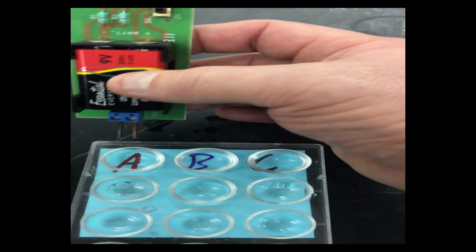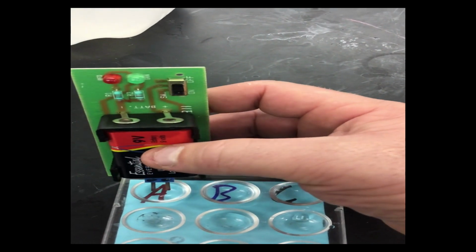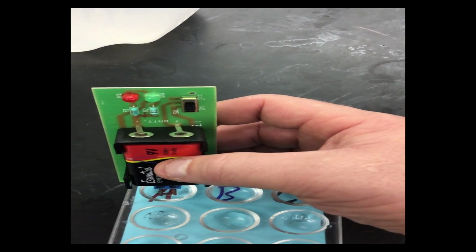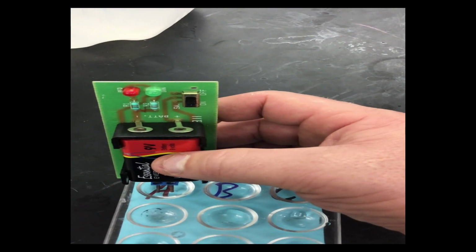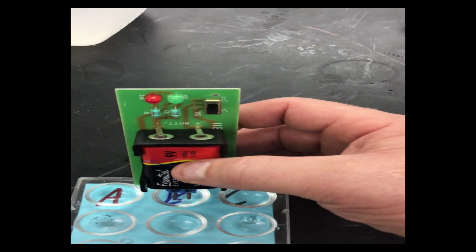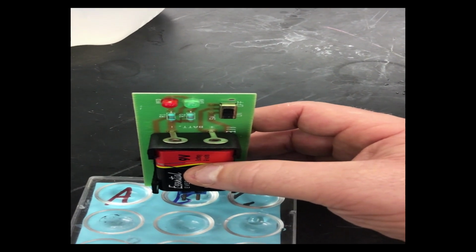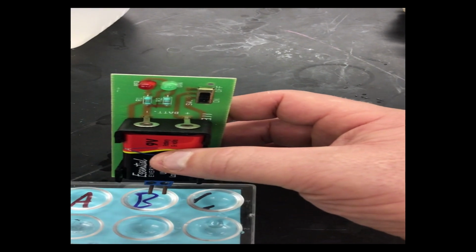So let's start with A, and we'll place this in A. And same idea there, we're getting just a little bit of that red light to show, which tells us that this is basically conducting the same as distilled water, which we use to make the solution. So the compound A is not adding anything to the conduction. We move over to B, and with the same idea, where we're just getting that red light to light up inside of here. So we're getting no new conduction with B. So both A and B are causing no new electrical conduction.